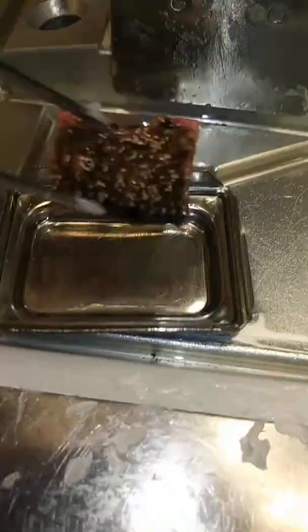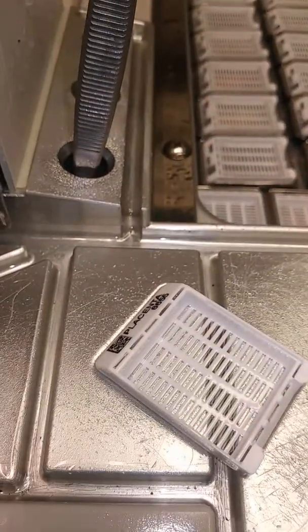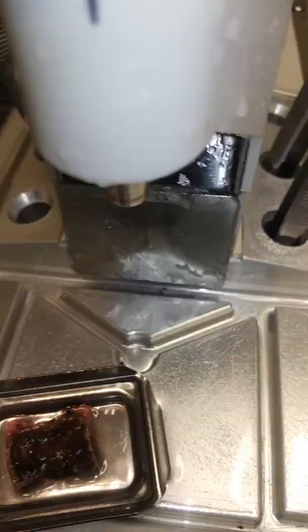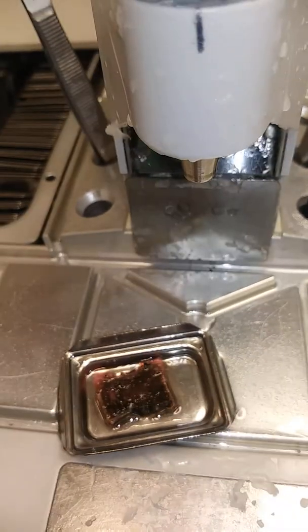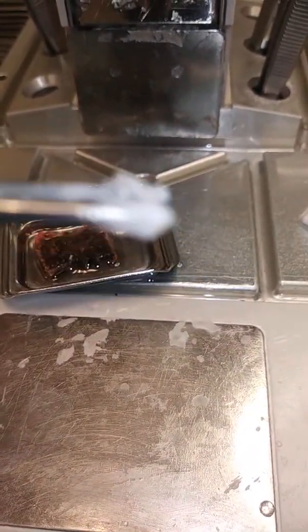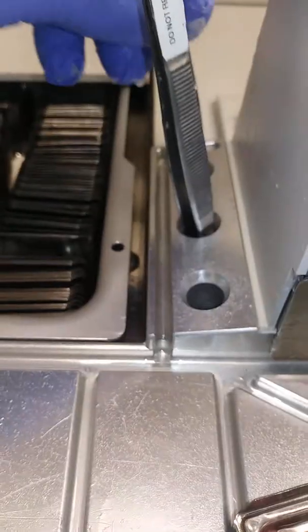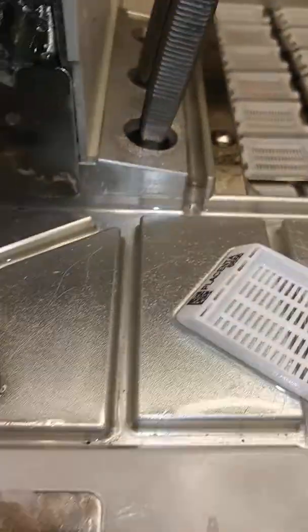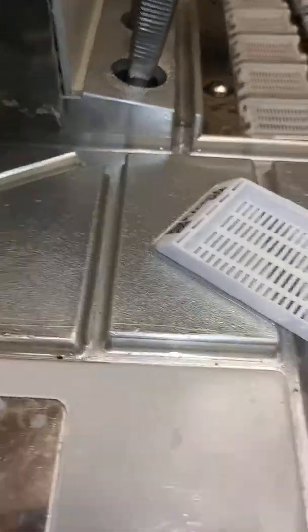Just a beautiful piece of placenta here. Sometimes when you also get wax on it, you have to put it inside this hole here to melt it and put it into a mold like this. Just a placenta — you move it over like this.